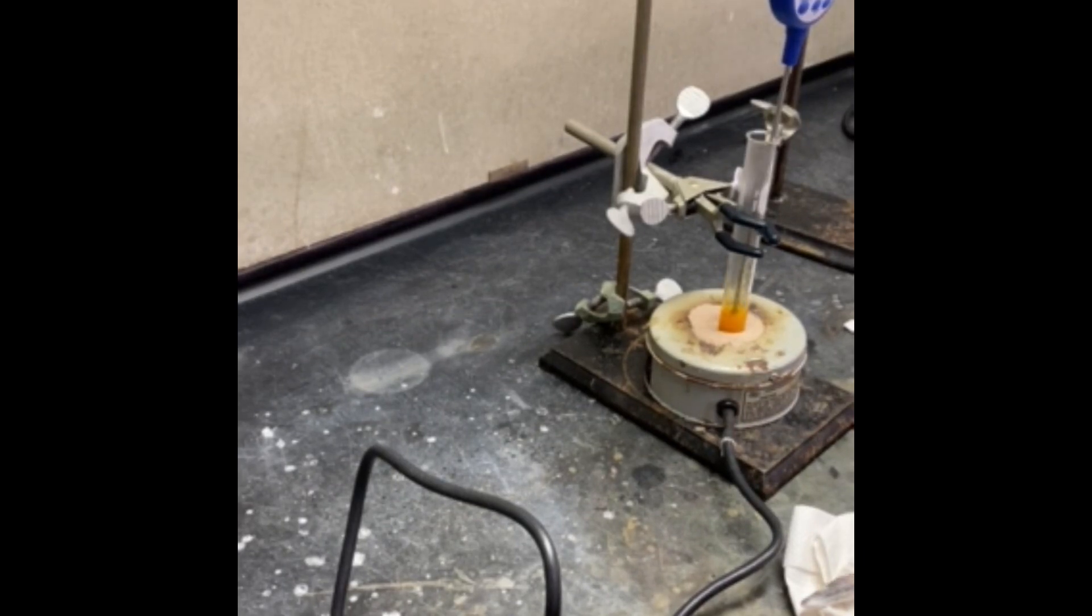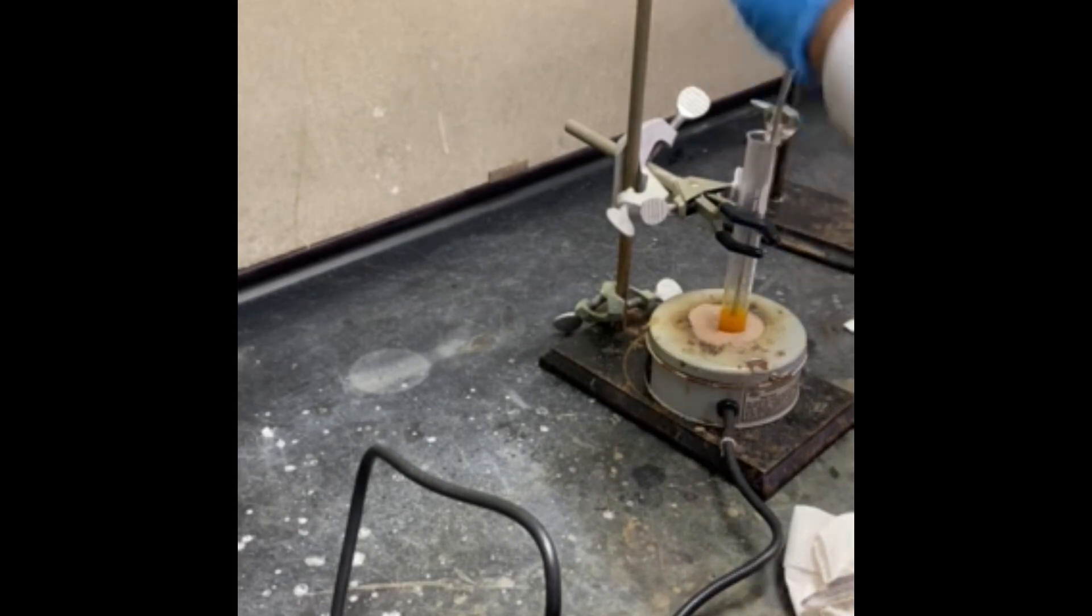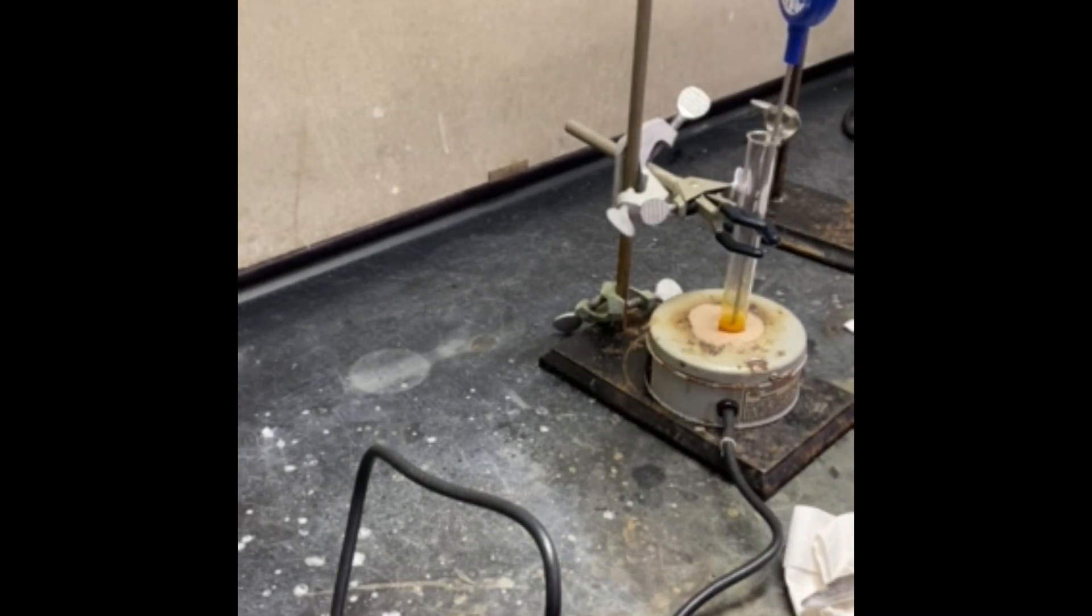Now it's 195, 196. Now 215°C, so we're going to keep it around that temperature for five minutes.